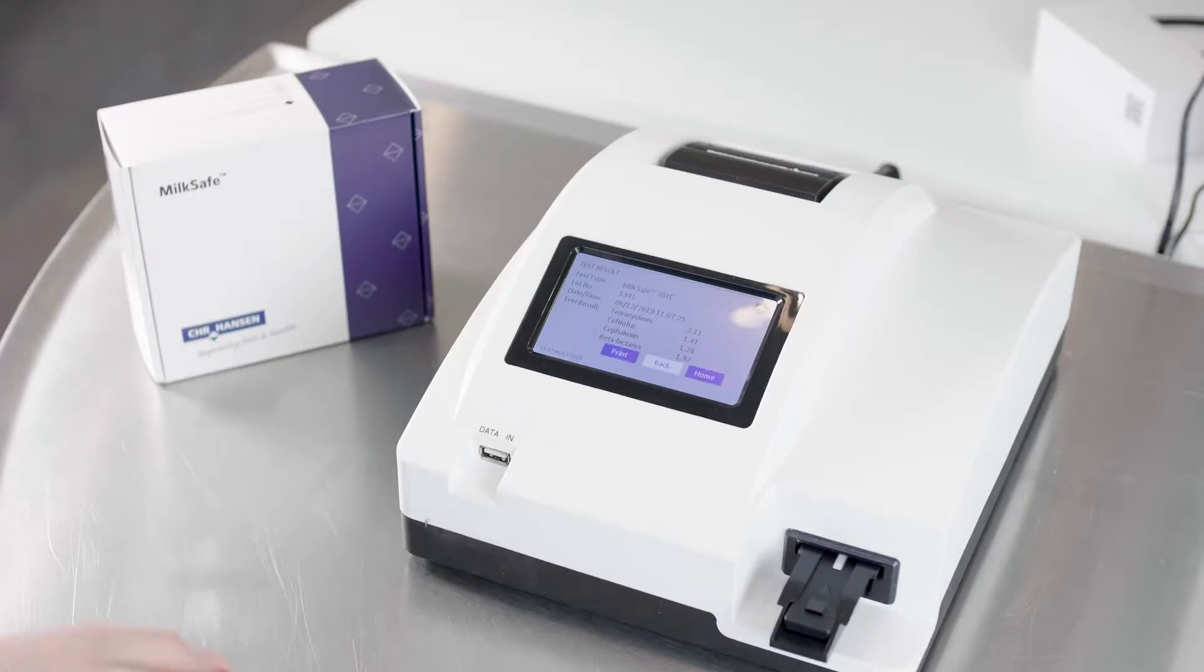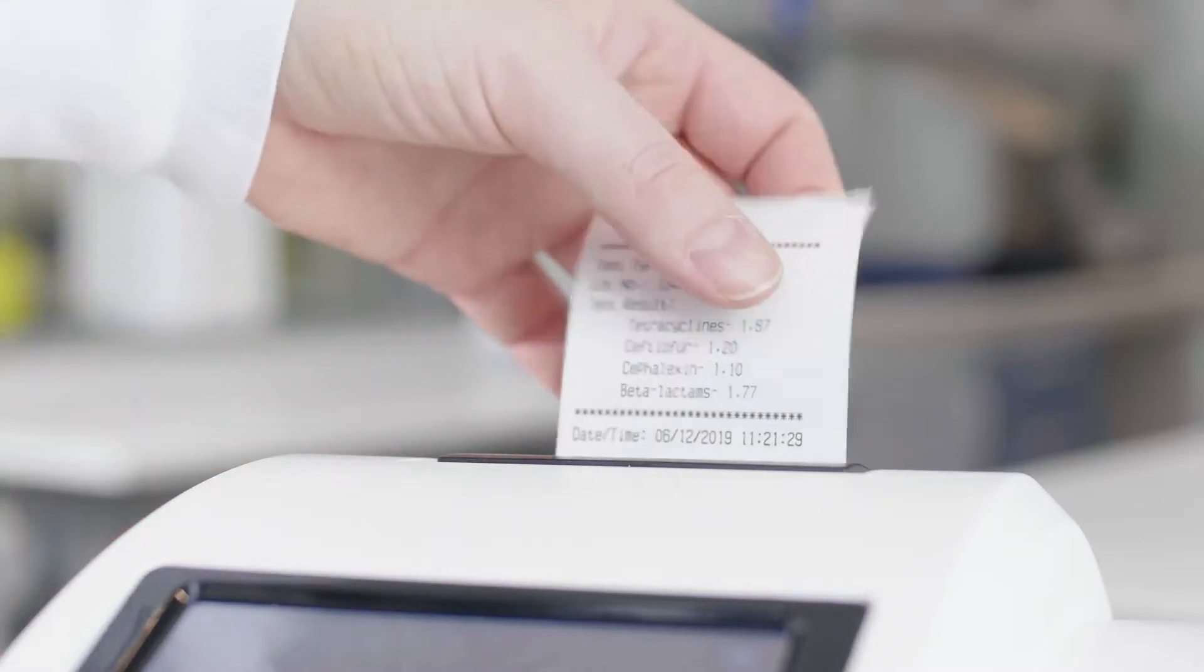Now you can read the results. The results are automatically stored on the reader. You have the option to print the results directly from the reader or integrate them with your LIMS system.